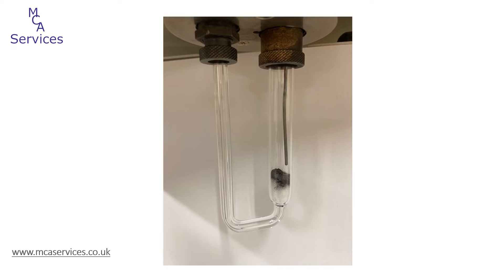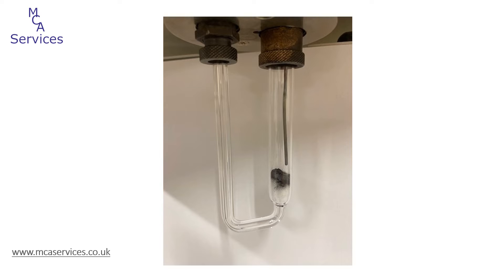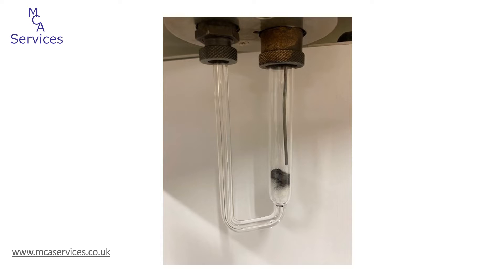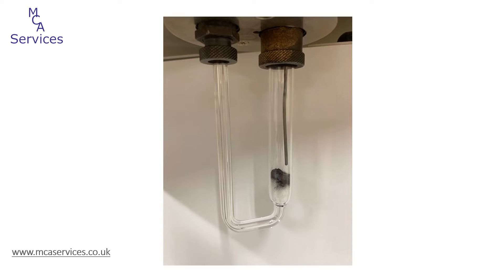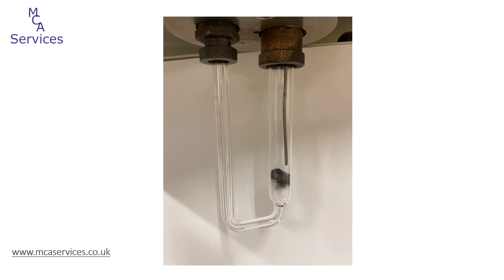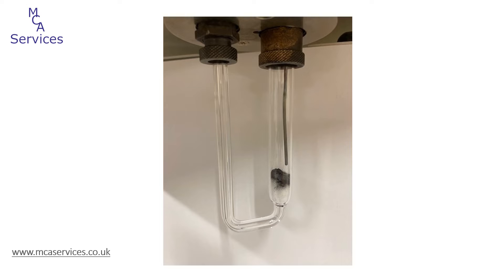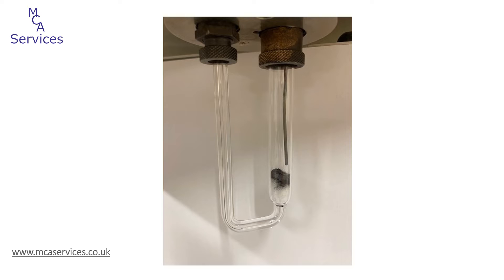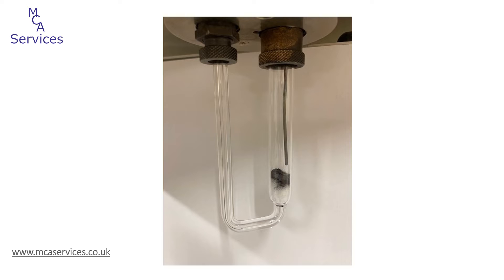This is a sample tube installed on the instrument. This time we've got a sample of manganese dioxide sitting just on top of the quartz wool in the bottom of the tube. We can see the sample thermocouple within that side of the tube — the tip of which is sitting just above the manganese dioxide sample. So we're going to be monitoring the temperature experienced by that sample as our experiment is run.